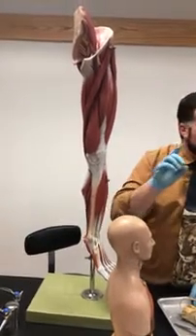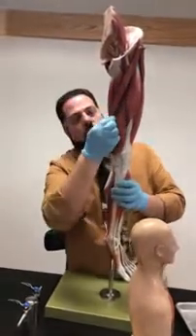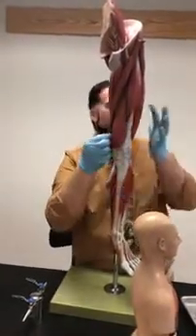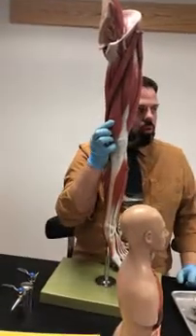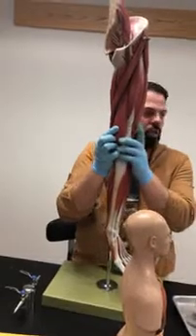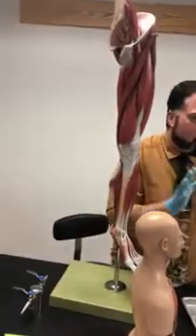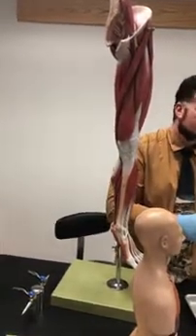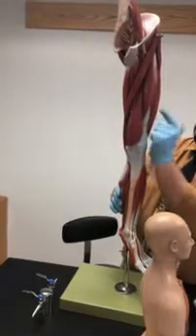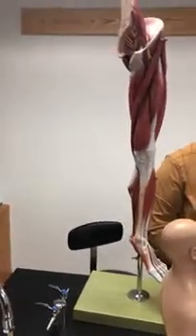Then we got teardrop ones. Again, in Latin, we say the word vastus, meaning teardrops. So we got one teardrop here, and one teardrop here, right? So what is this one called? Vastus medialis, vastus lateralis, and where's the third one? What's the third one called? Vastus intermedius. Where would that be? Right, it would be in between the two vasti over here, but it'll be deep to the rectus femoris. Okay, so let's look where these are.